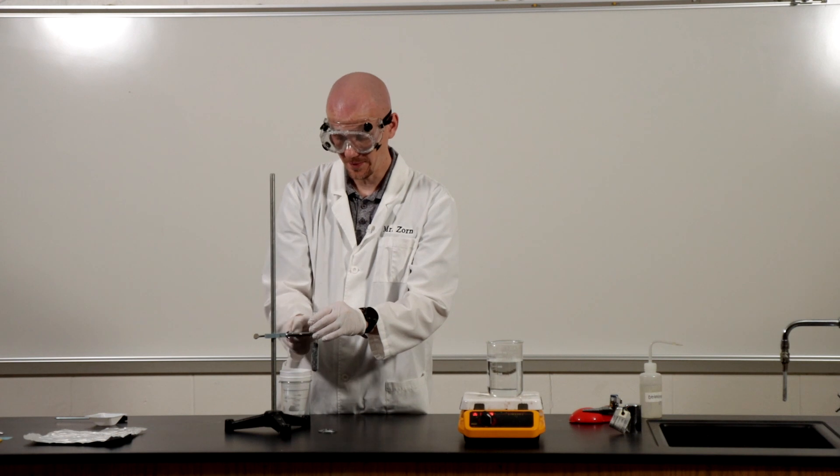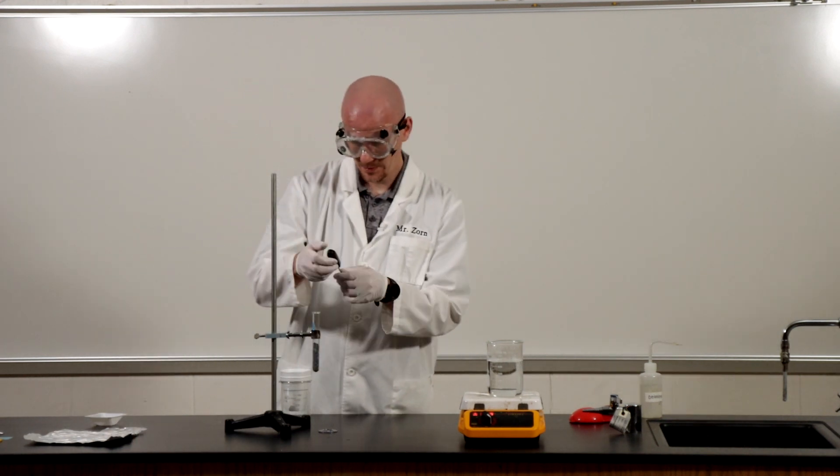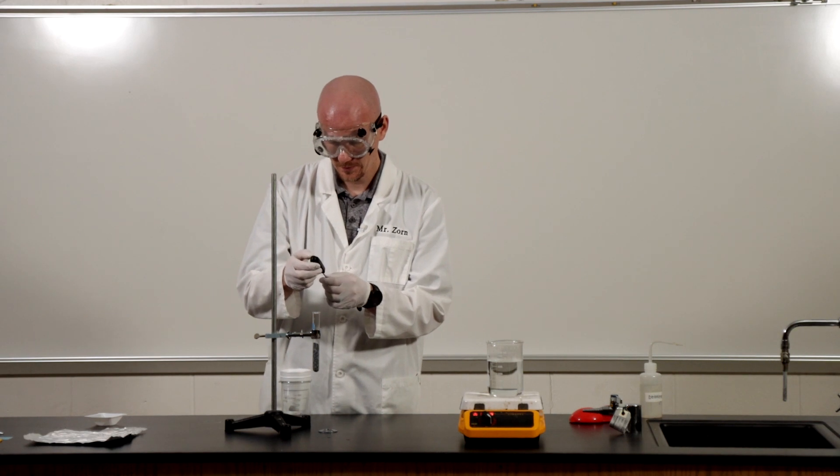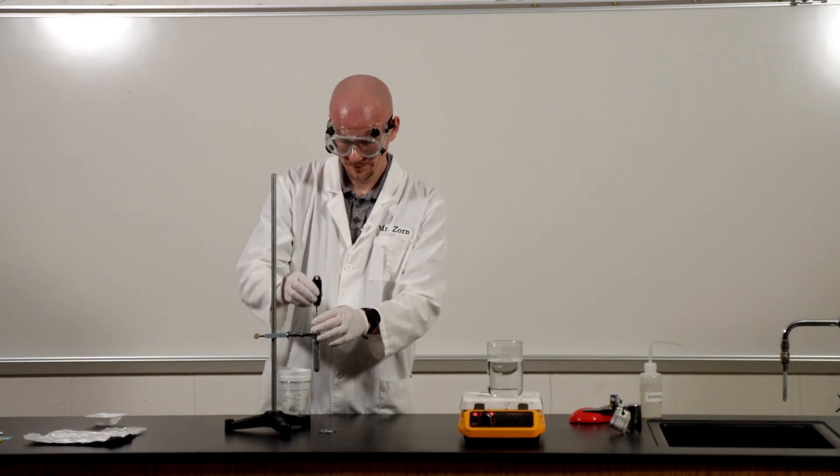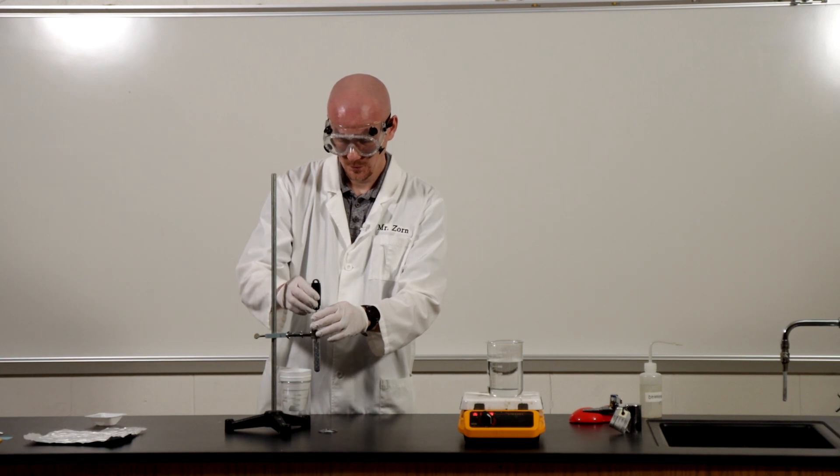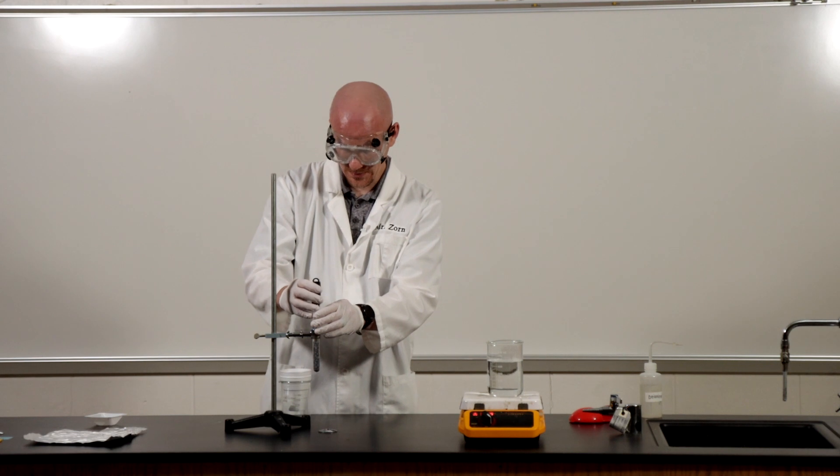Try not to clamp your gloves to the clamp here. I'm going to put my thermometer in here. Okay, you want to be careful that the tip of your thermometer does not touch the bottom of the test tube here.